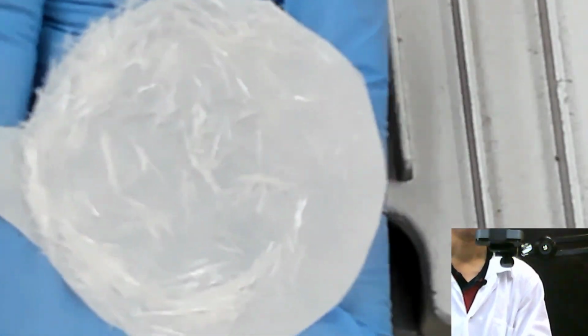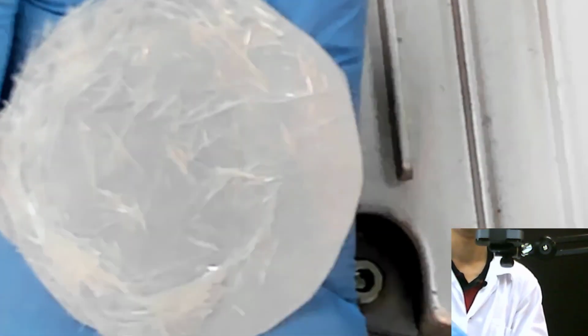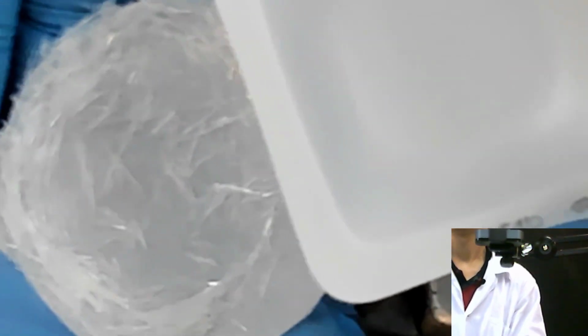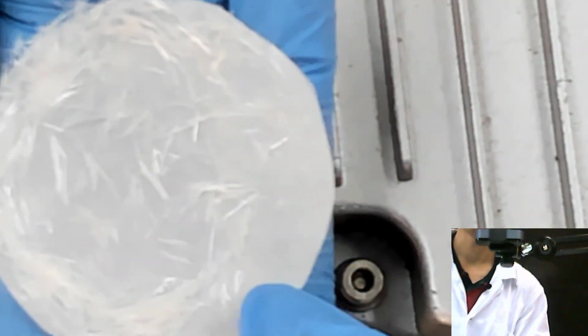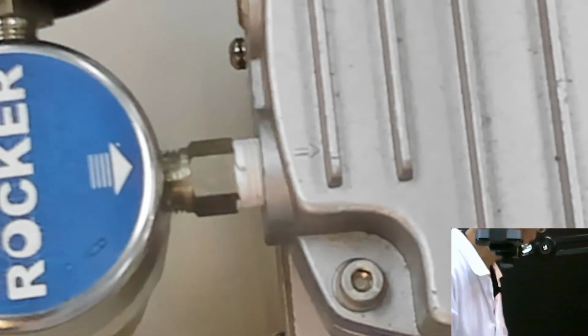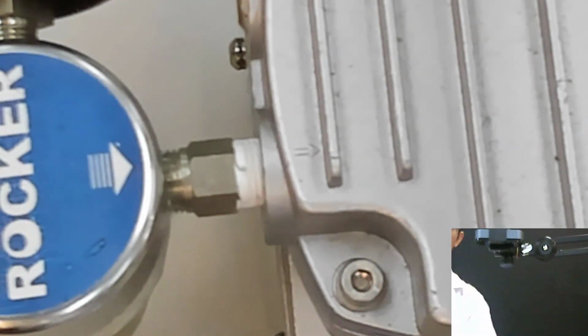Okay, so you see, if the weight of this is not the same as the weight that I put when I started, then you will be sure that there is some impurity there. In your lab report, just make some values: put some value of the original, and also put some value of what you weigh later. So at the end of the day, you will get something like this.